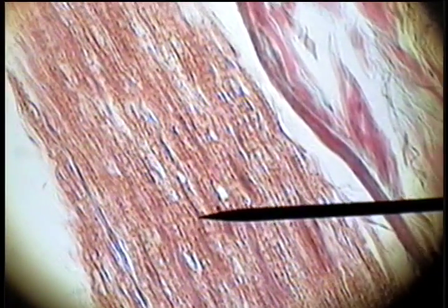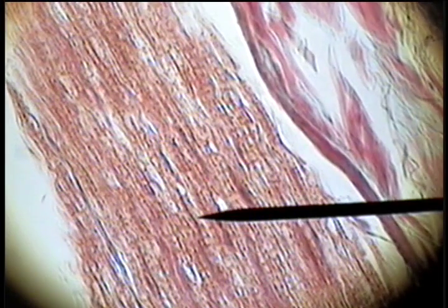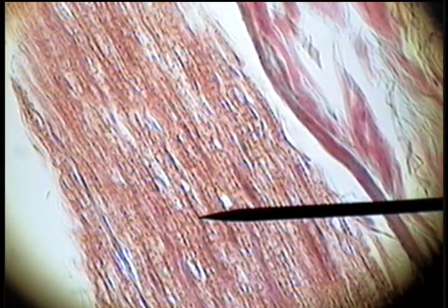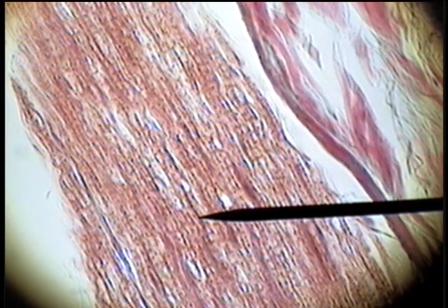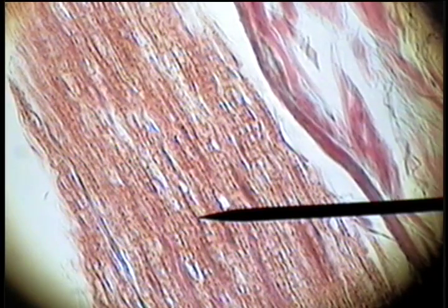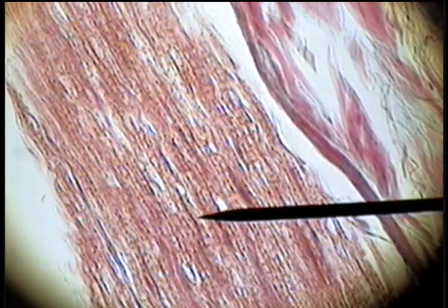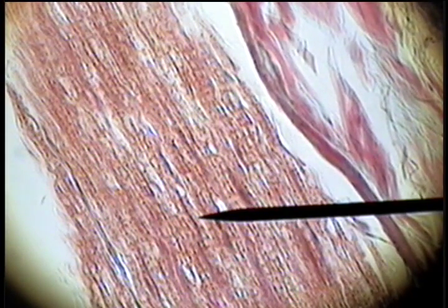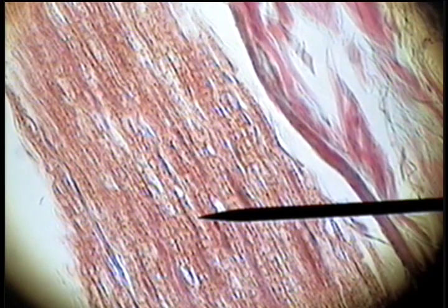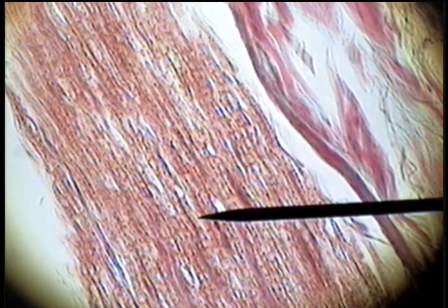This could be an axon or a dendrite. Here is the axon again, this lighter area, the myelin sheath, and then the endoneurium, the outer covering.